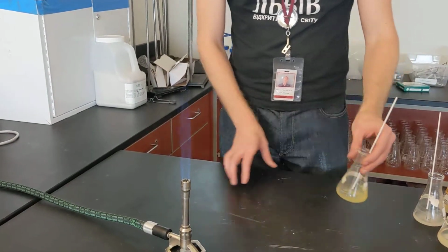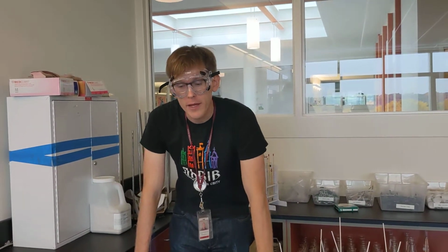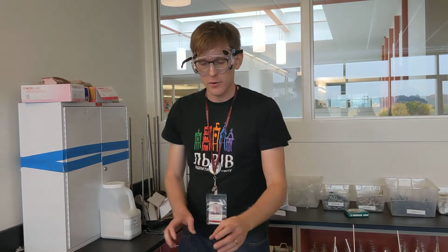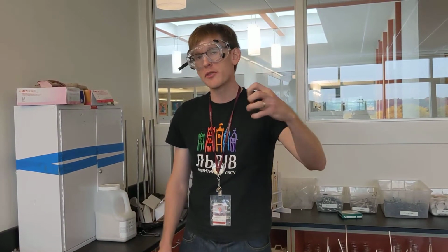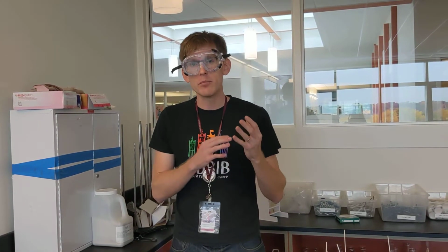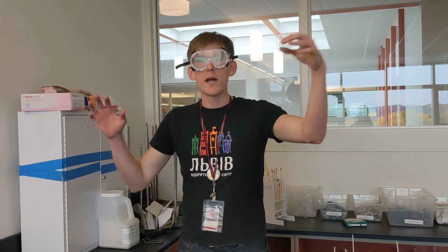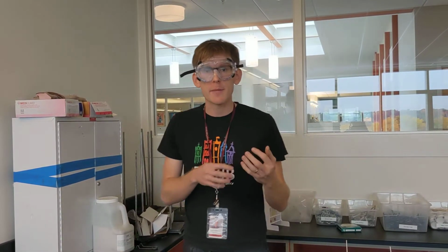There's a good reason for it. The cobalt glass absorbs the wavelength of yellow that's coming from the sample. So the yellow comes out, it hits the cobalt glass, the cobalt absorbs that yellow, and actually the reason why the cobalt glass has that deep blue color is that our eyes perceive white light minus that yellow as cobalt color, that deep blue. So what we're seeing is the absence of that yellow color.